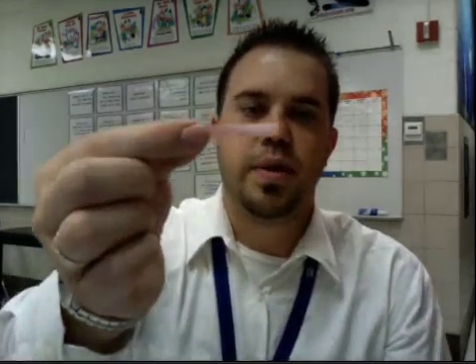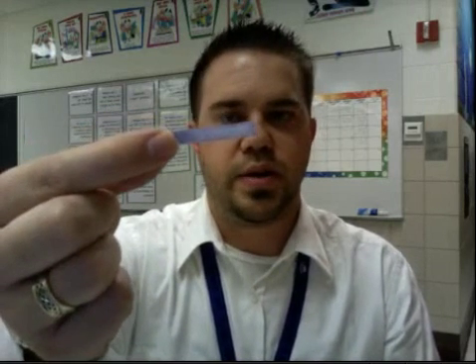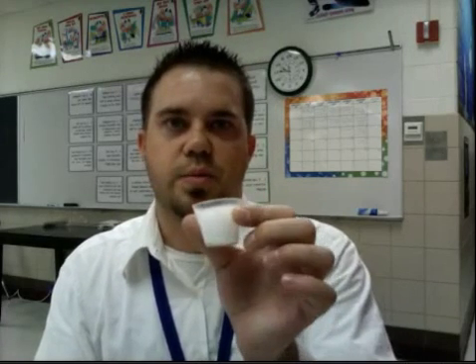Next is hand soap. So with the hand soap, let's see what happens with the red litmus paper. And this hand soap isn't the best that we have. There really isn't much of a change with this hand soap and the red litmus paper. Let's see if anything happens with the blue. And again, with the blue, there really is not a change. If you remember from your notes that your teacher talked to you about soap, in the notes it does say whether soap is typically an acid, base, or if it's a neutral substance. Because of the type of hand soap that we have today, the results aren't the same as what's in your notes. So just kind of a heads up on that.